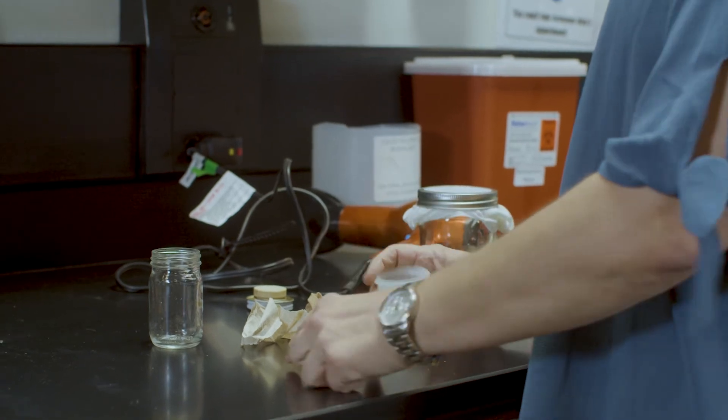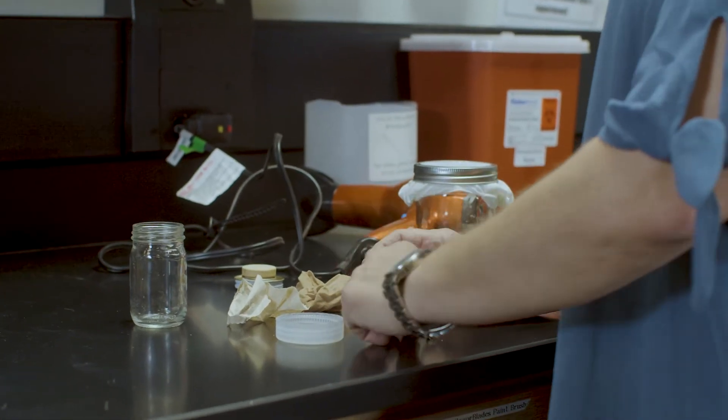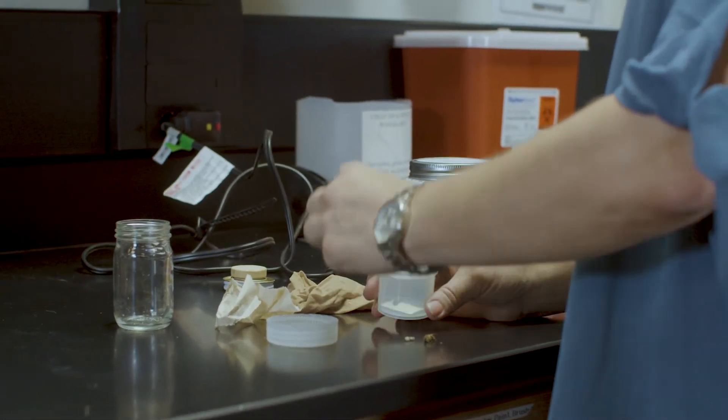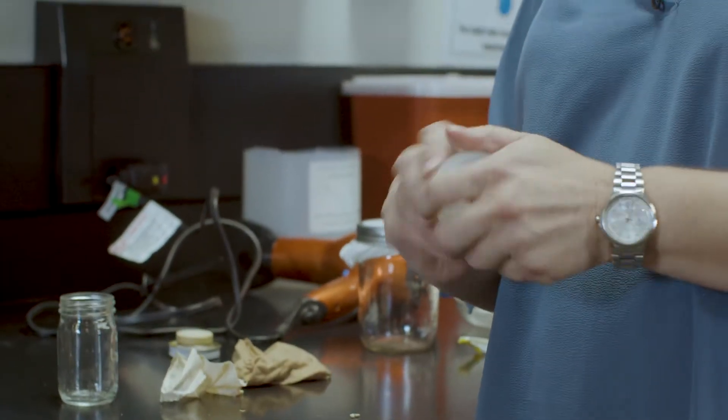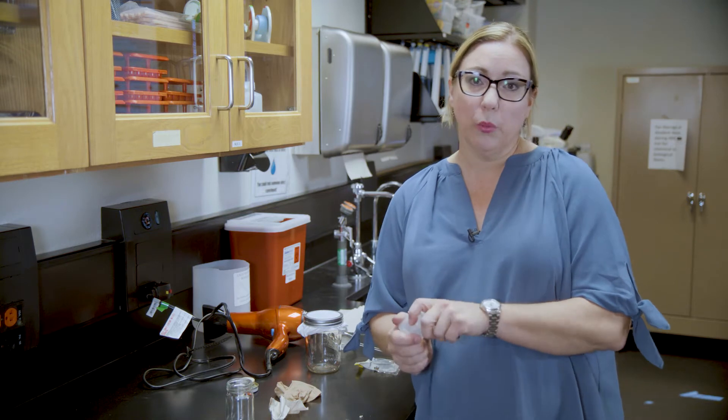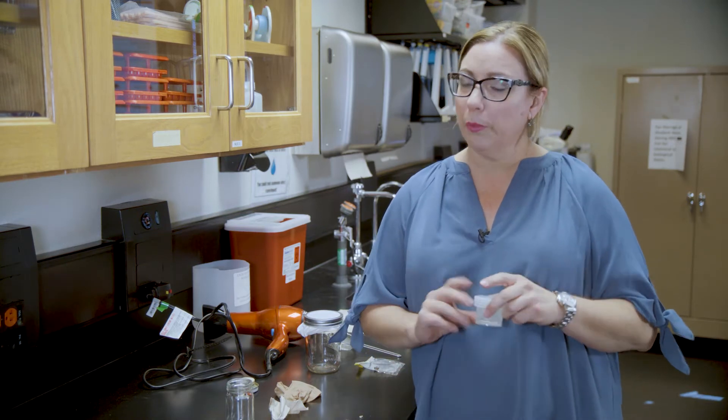You can just pick the specimens up with your fingers. They are very pliable at this point. If you freeze them for a week, they may be a little more brittle, so be careful.